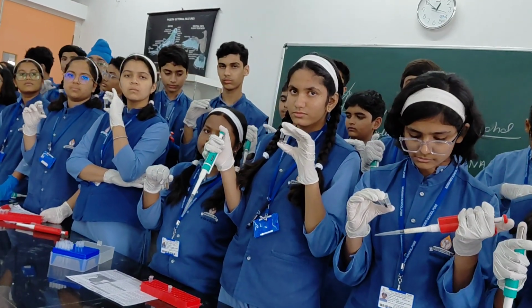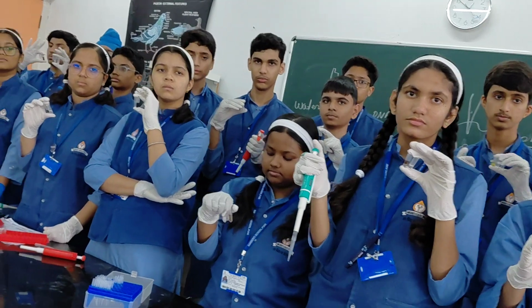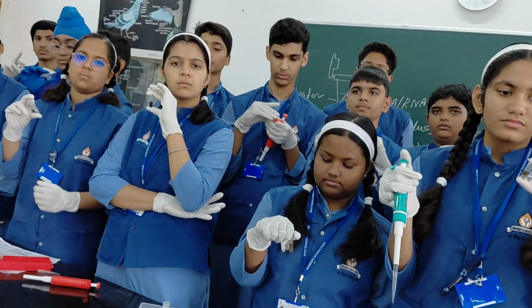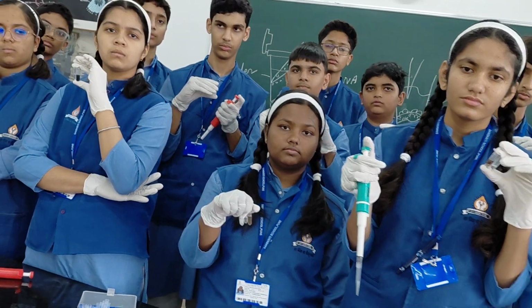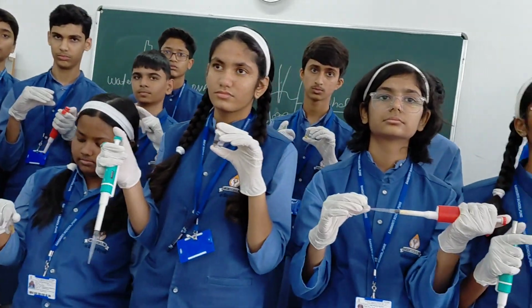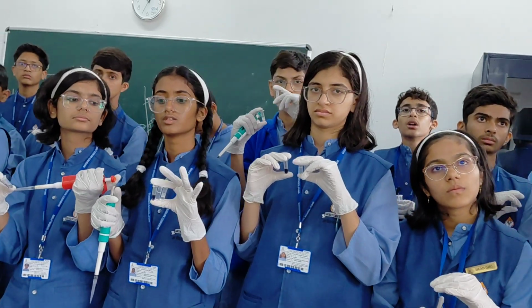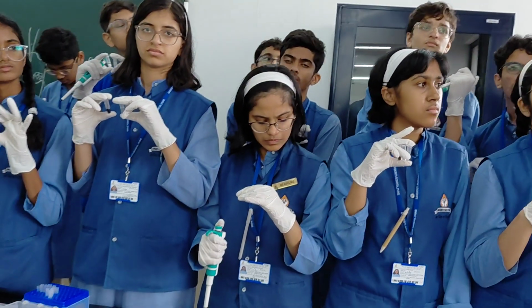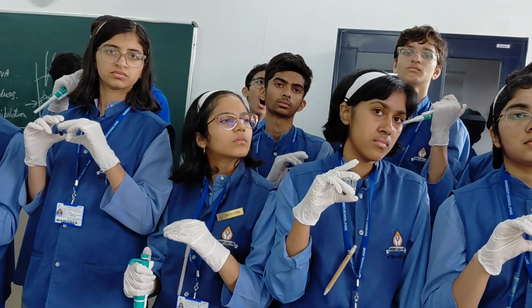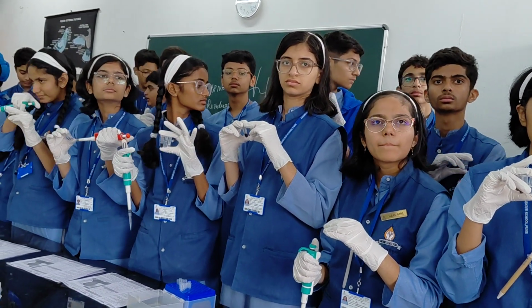That comes from electrophoresis. There are two kinds of electrophoresis. One is called agarose gel electrophoresis. Another is polyacrylamide gel electrophoresis. You might have seen eye lenses that are developed through polyacrylamide gel. Like this glass, it is clear and a very thin layer is utilized. In that, DNA runs and DNA sequencing experiments are done.